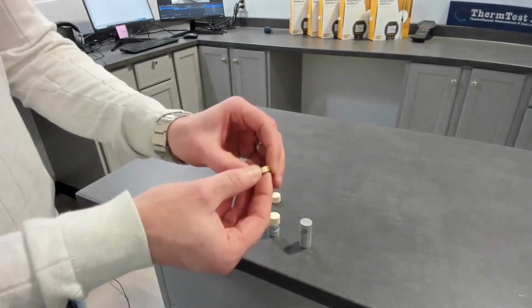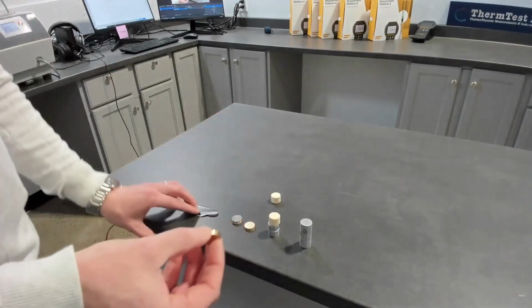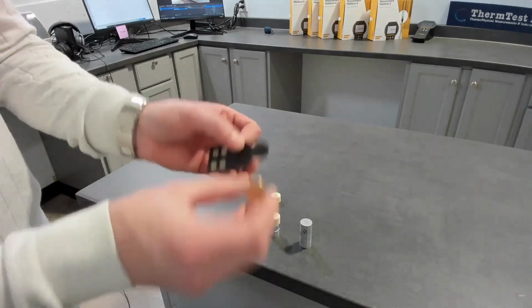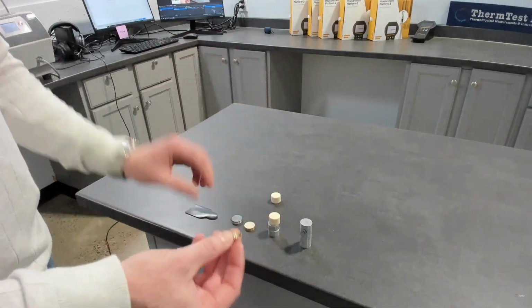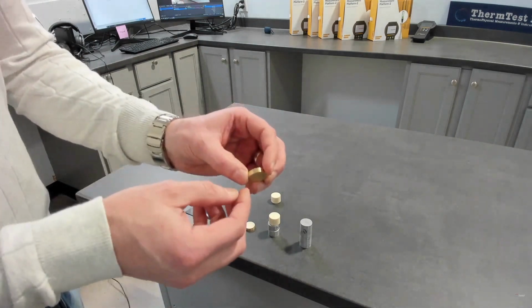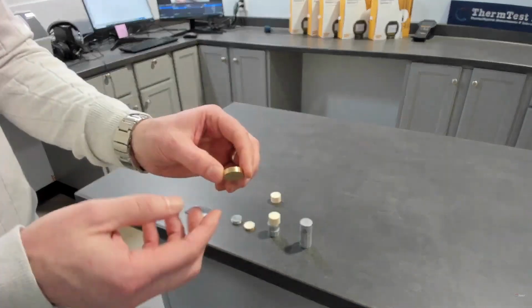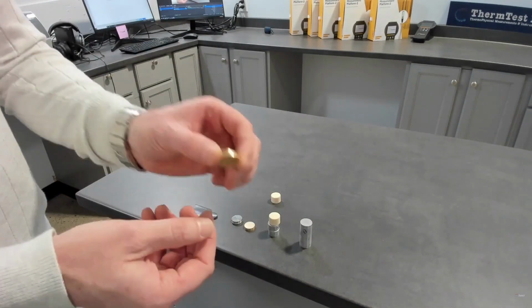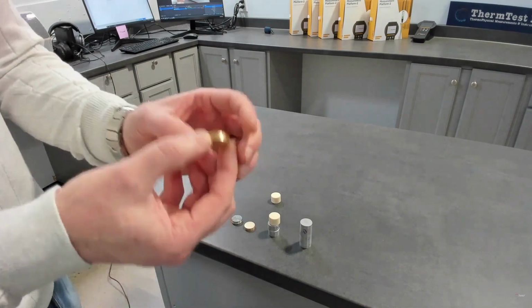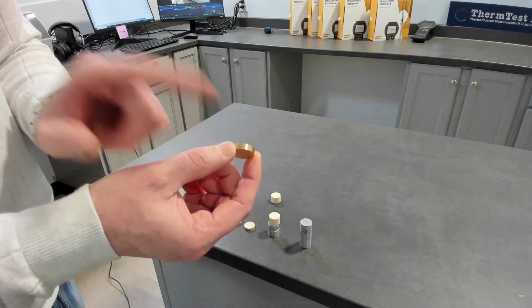So this is an example of a one-dimensional sample. This is 21 millimeters in diameter, which matches just slightly larger than our 20 millimeter sensor. This is about 10 millimeters tall, I believe, 5 millimeters tall, sorry. From that, we'll show you some data: we get thermal conductivity, thermal diffusivity, and specific heat. That would typically be a relatively difficult sample to measure with just one-dimensional because we'd be trying to keep the heat within the boundaries.